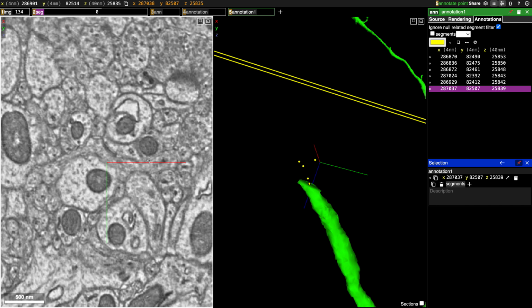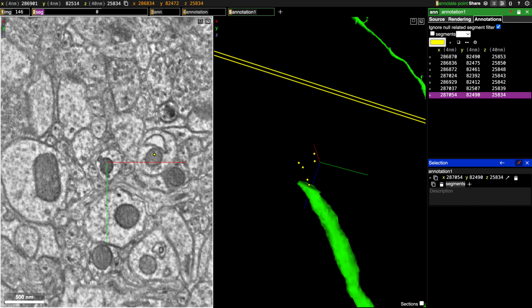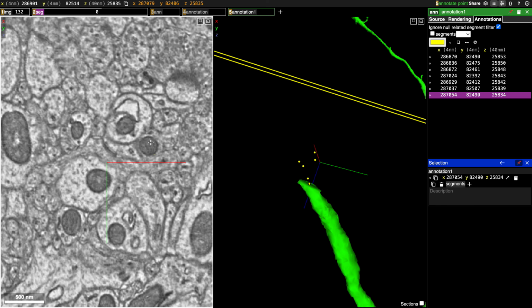You don't have to do it on every slide, but just when you're sort of missing the trajectory of where the branch is going, you might want to start placing a few points to keep track of what you're looking at. Alright, so you can see it totally disappears in this slide. That can happen sometimes, but as we go to the next slide, especially if you go quickly, you can see these two cells are jumping up here.